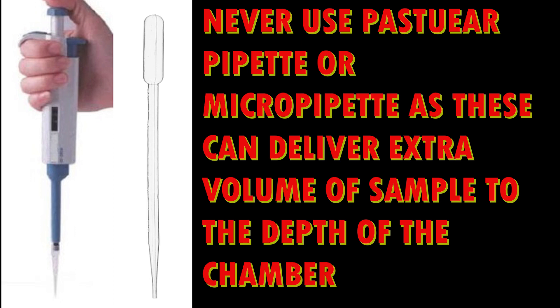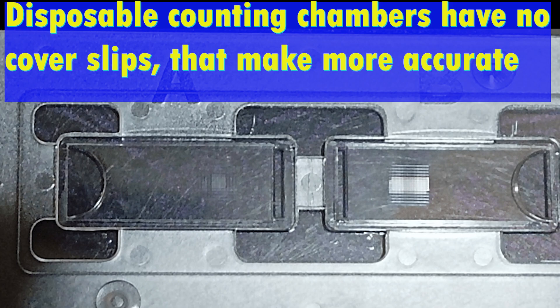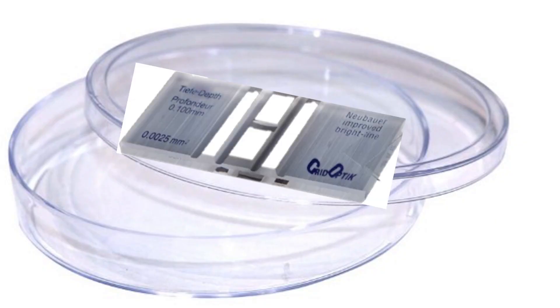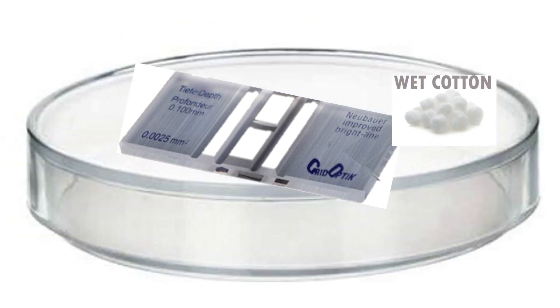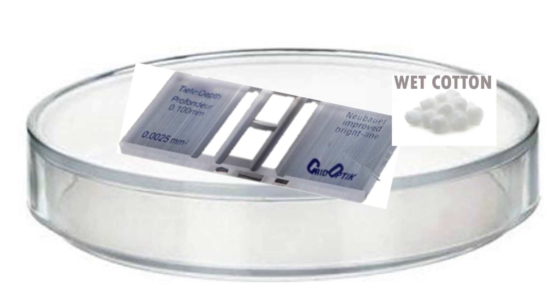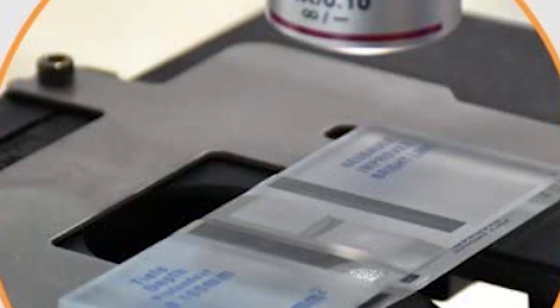The sample should cover the entire area; the cover slip should not float or be overcharged, as this causes counting errors. After charging the chamber, place it in a Petri dish containing a wet cotton ball or wet tissue paper to allow cells to settle and to prevent drying of the sample.